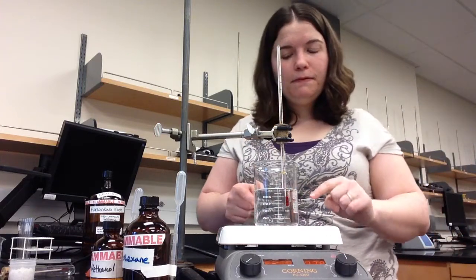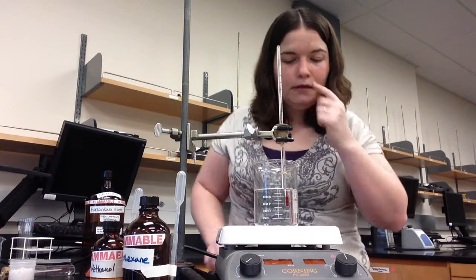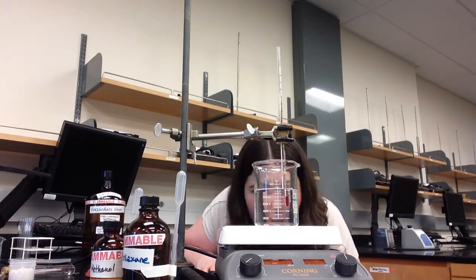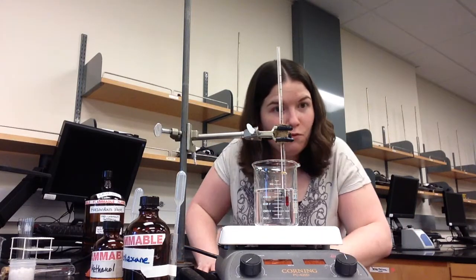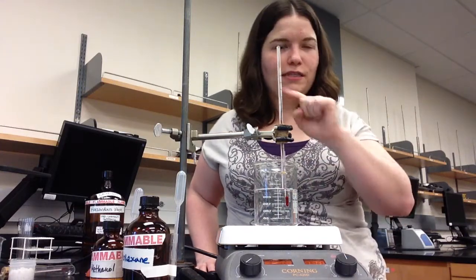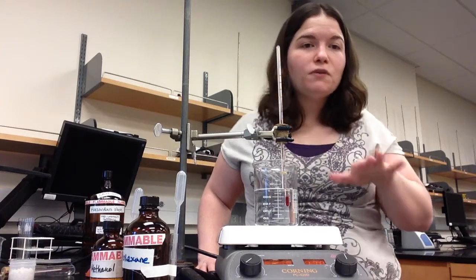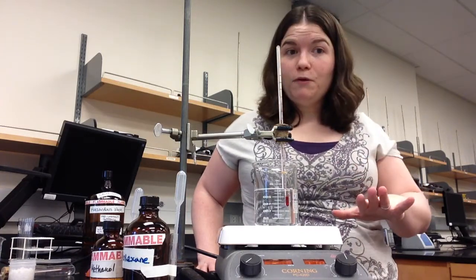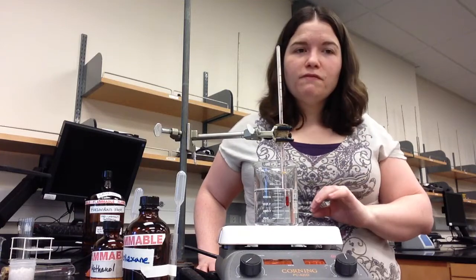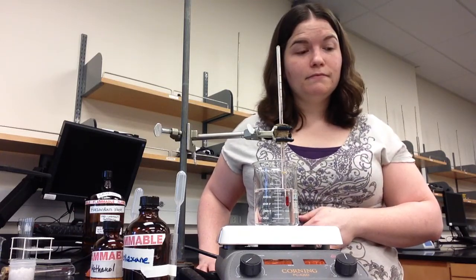The water will heat up from the hot plate, which will increase the temperature of the solid until it melts. You're going to want to keep a close eye on the unknown solid. It will start white, and once it melts, it turns clear. Make a note of the temperature change as that happens in your laboratory notebook. At this point in the experiment, you have finished all 3 parts. And if you're happy with your data, you can stop. If you have time, you can repeat any of the 3 parts that you would like to get additional data.